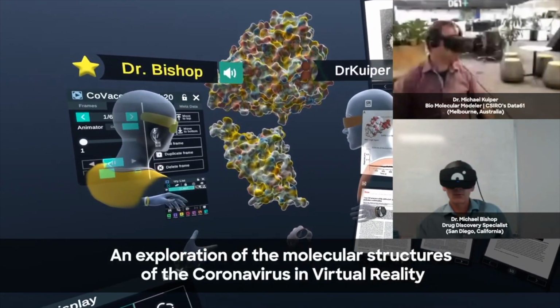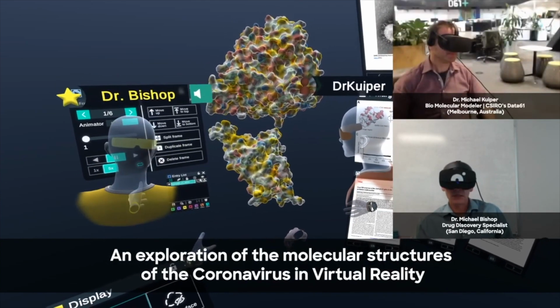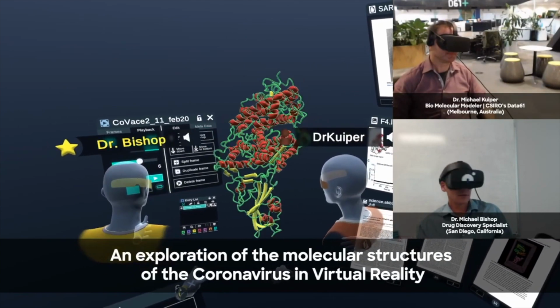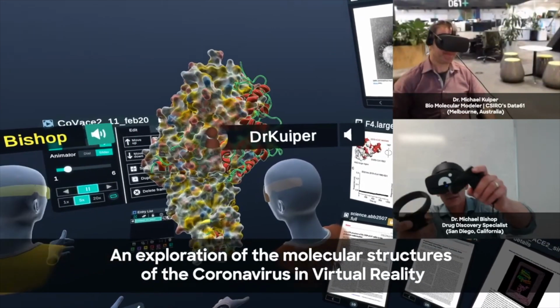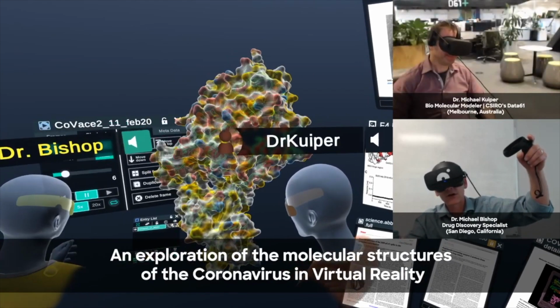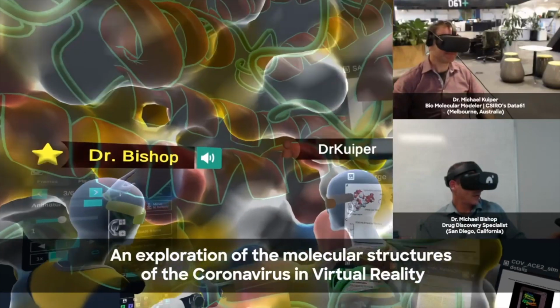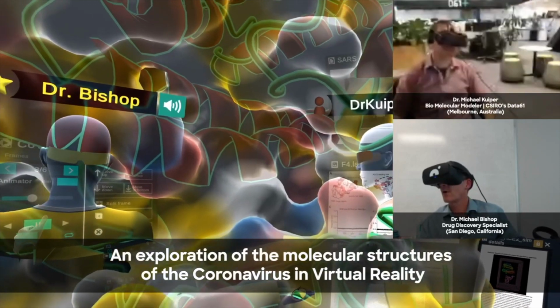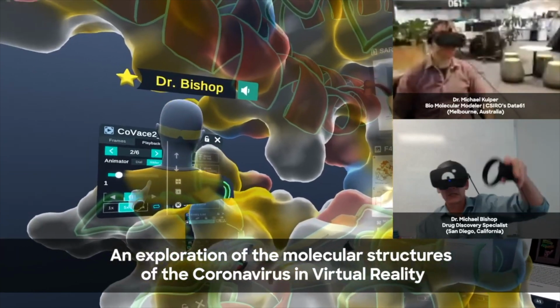I'm going to go ahead and run forward the frames, and we can see as it comes together. I'm going to go back to 1 and move it over. Yeah, we can see it start to come together there. Yeah, that is very nice. And what I really like in VR is just being able to get in here, make it very large and be able to get in and see these interactions as they're starting to form. I'll go back a frame and we can see just as it's starting to get in there close. Really remarkable. And I'll back out again and really get a sense for this.